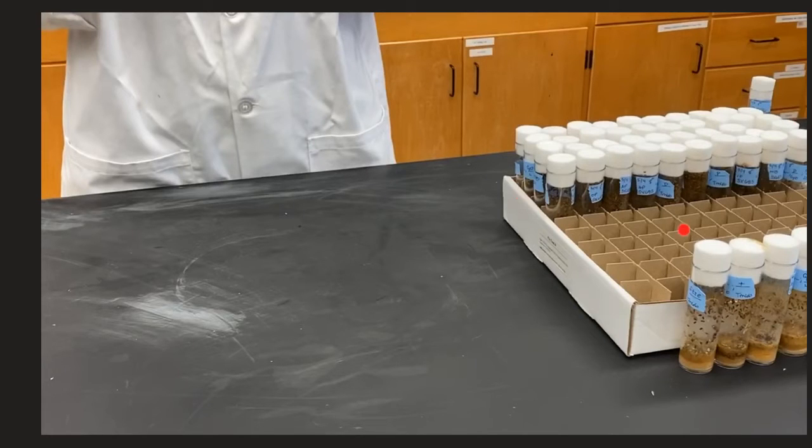Here you can see the tray of lines that we have. Again, each column is one enhancer trap line. The back vial is the oldest vial and the front vial is the newest.